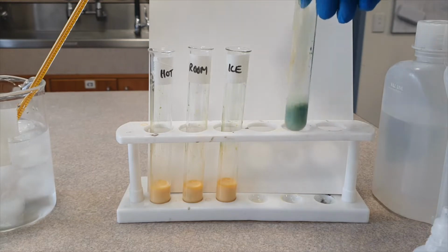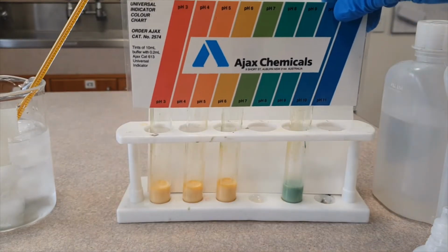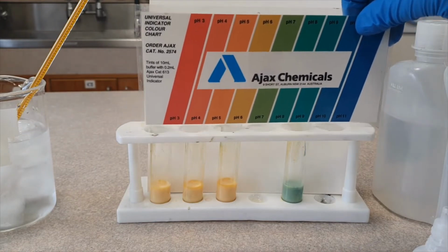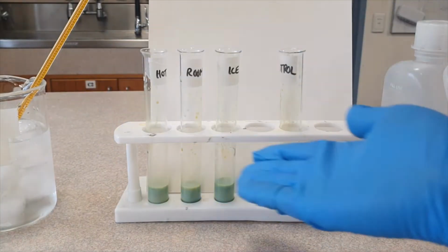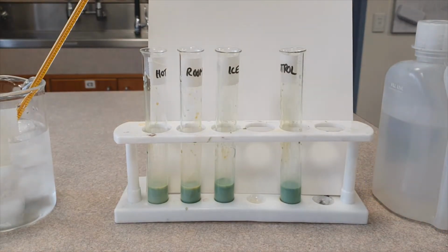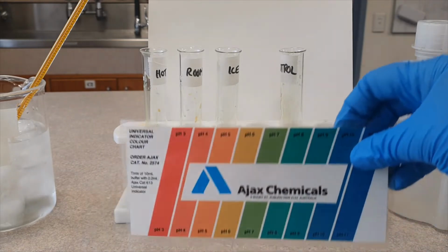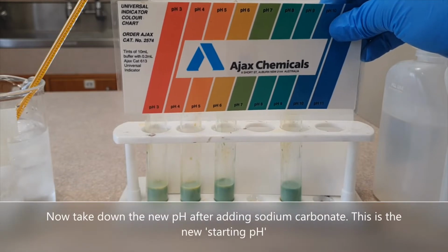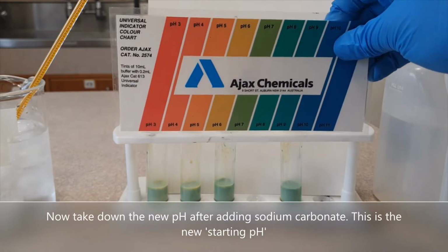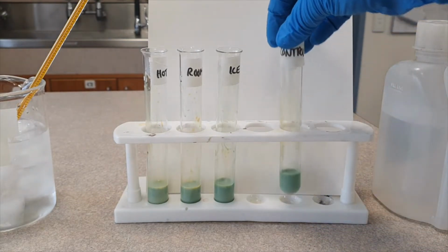Whoa, you see that? So now, what pH is it at? We've pushed it a little bit. So I'm going to do that to the rest of the tubes. Okay, so now they all have the same thing in them. They all have 3 ml of milk, 5 drops of universal indicator, and 3 drops of sodium carbonate. Which pH do you believe they're at? Write that down, because this is our starting pH. Now we're going to put them at the temperatures that we want them to be at.